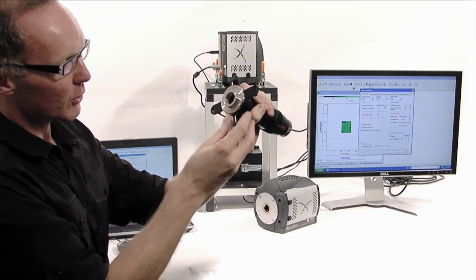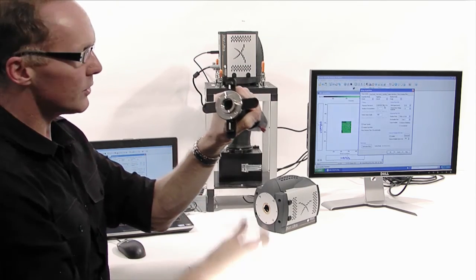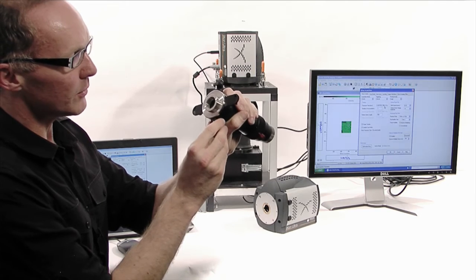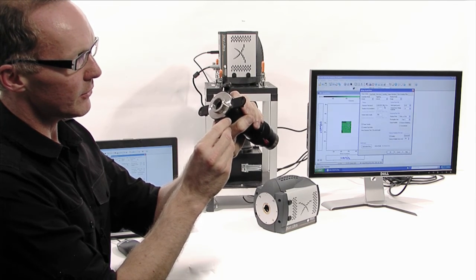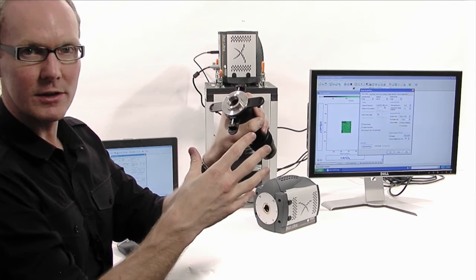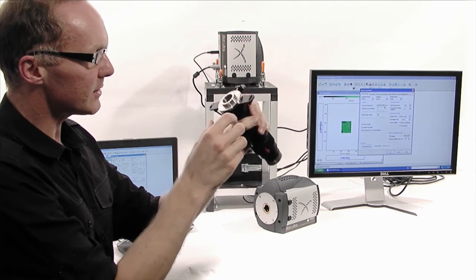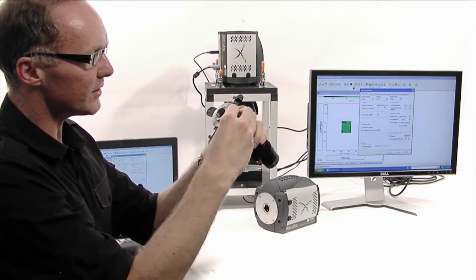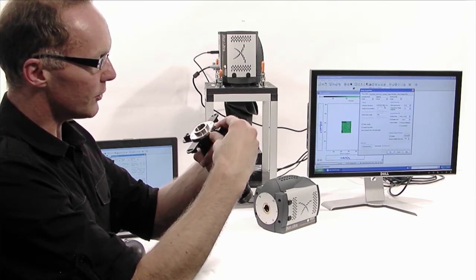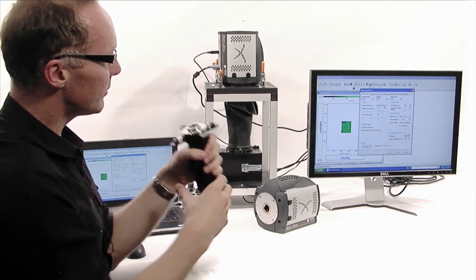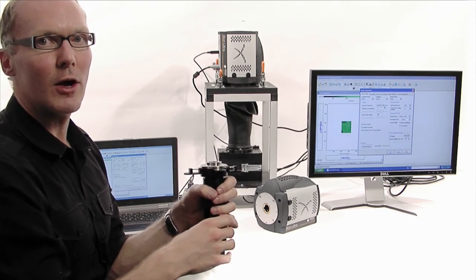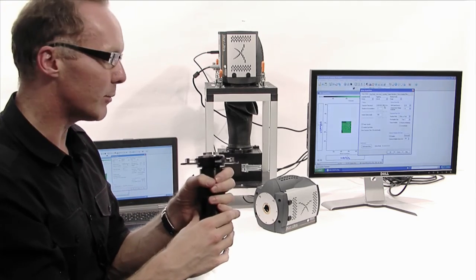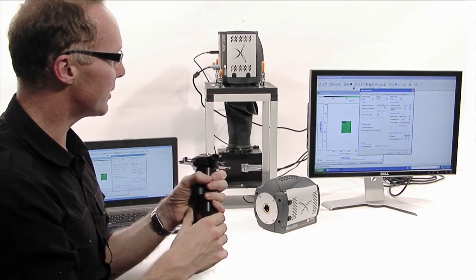On the software you can run in live mode and you will see in real time the region of interest being resized as you adjust these blades. Then all you do is match that up within the software and away you go. Hit the acquire button and you'll get the frame rates we just demonstrated.